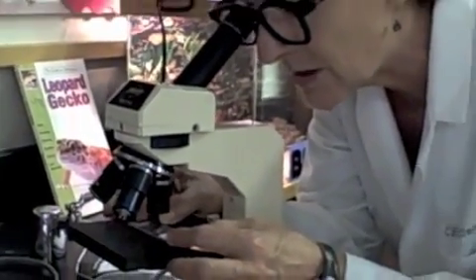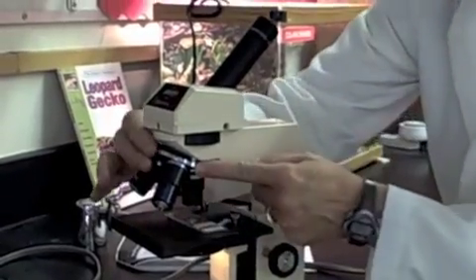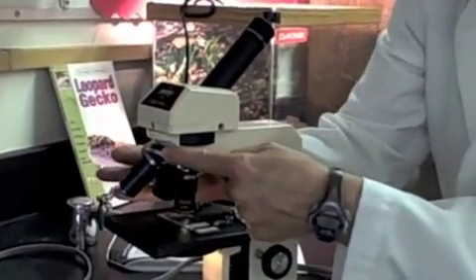We can adjust our slide slightly until the pointer that we see in the eyepiece is pointing to our specimen. We then move to a higher power, such as 10x.